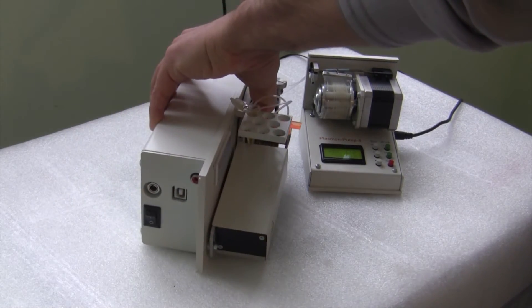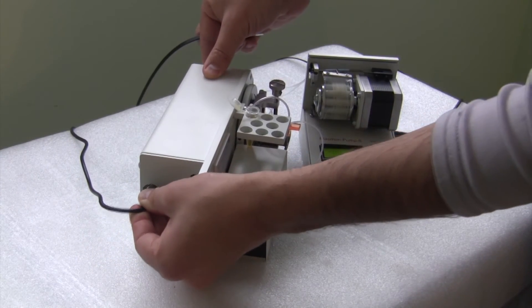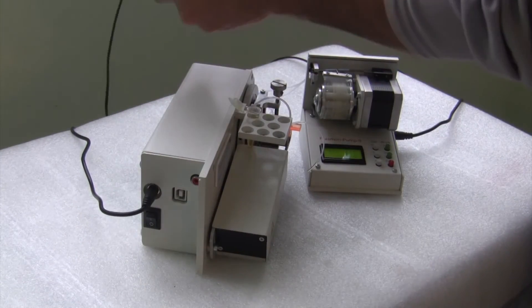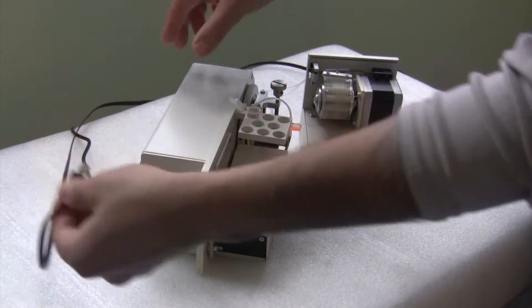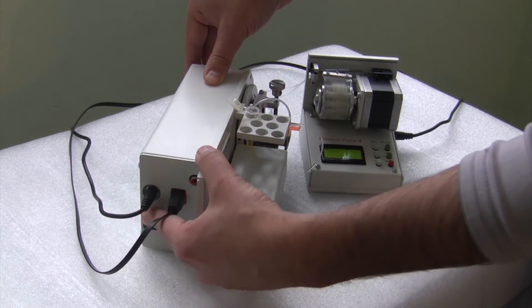Next, we are going to connect the power source to the device, USB connection and turn on the device.